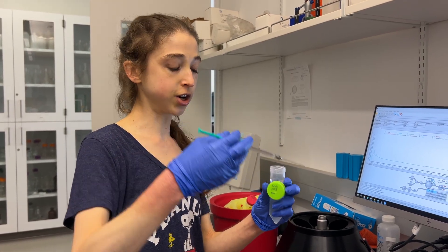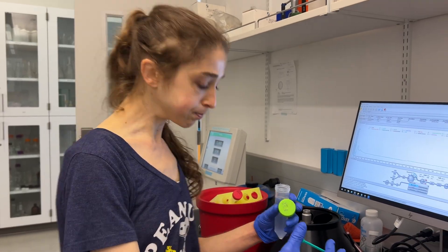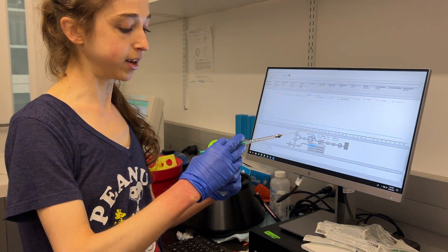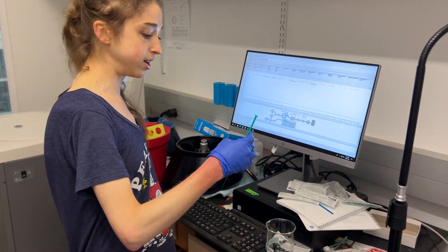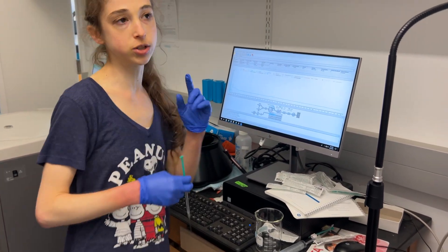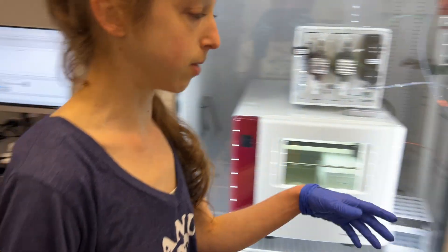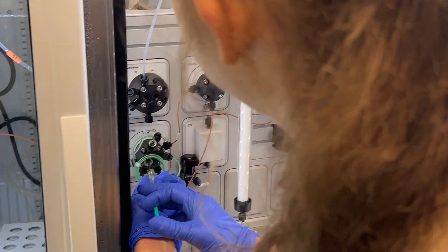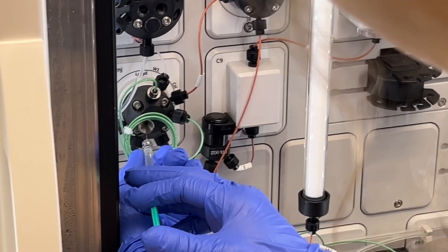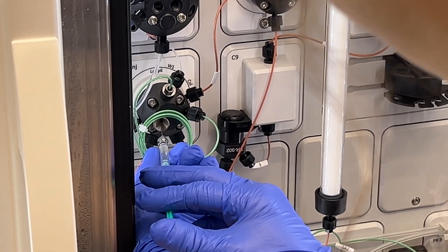Similarly, after you do the injection, you don't want the needle to clog too. So it's important that you go and wash the needle after your run, but you don't want to remove the needle during the run. I'm just going to do the same thing — inject, but this time doing buffer. So now I'm filling that loop with the buffer.